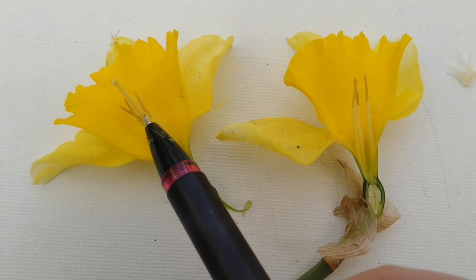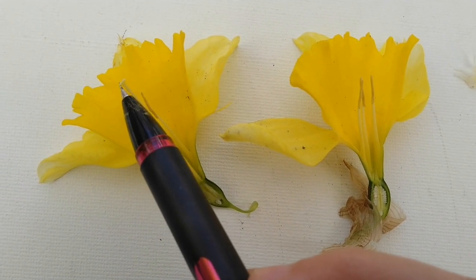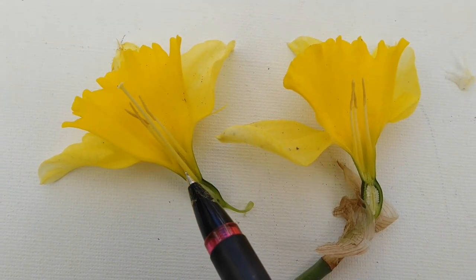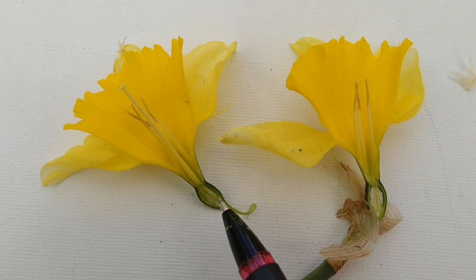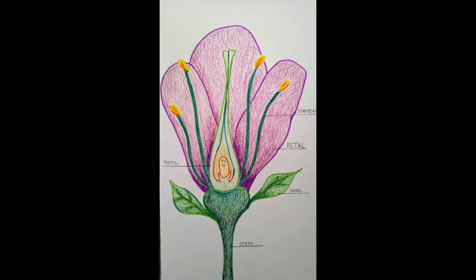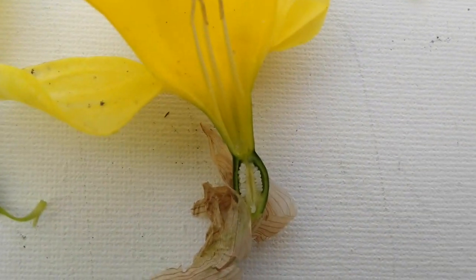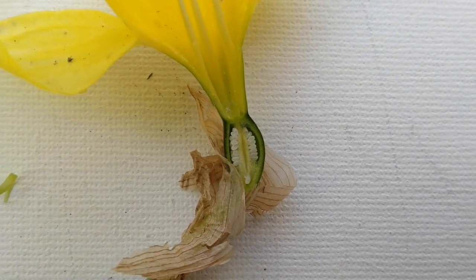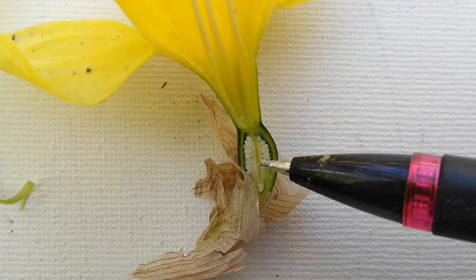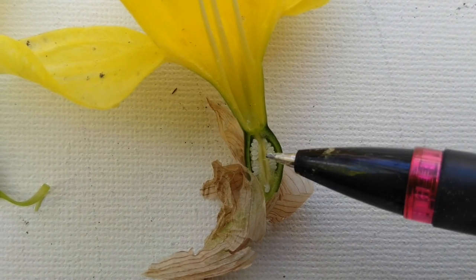And it has one pistil right here. This long part with the little sticky stuff on the end. The long tube that goes down into this nice hollow, just like in my diagram, right? And then if you look really close, I'm going to look at this one because this is where most of it went. You can see the little baby seed eggs. Boop! Those are those little white things on the inside.